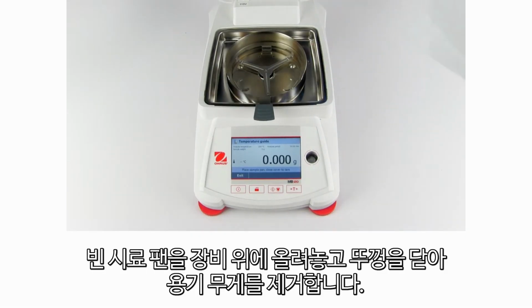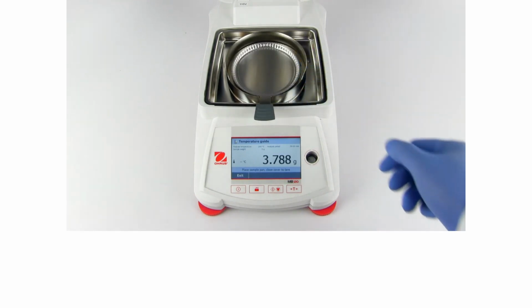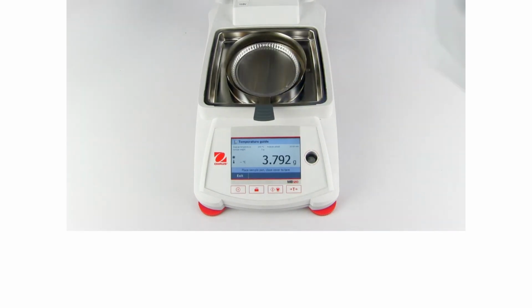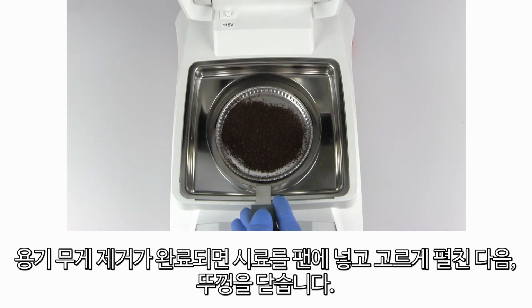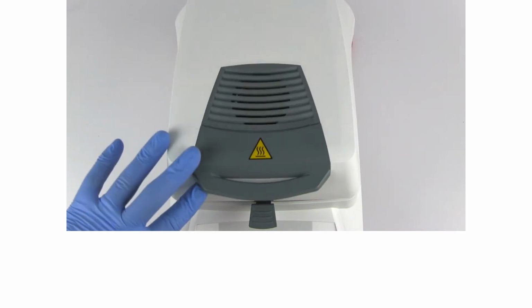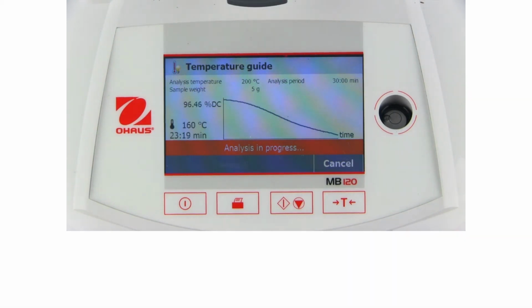Place an empty sample pan on the device and close the lid to tare. Once taring is complete, add the sample to the pan, distribute it evenly, and close the lid. A 30-minute measurement will now start, slowly increasing the temperature to the maximum analysis temperature while showing the dry content of the sample.